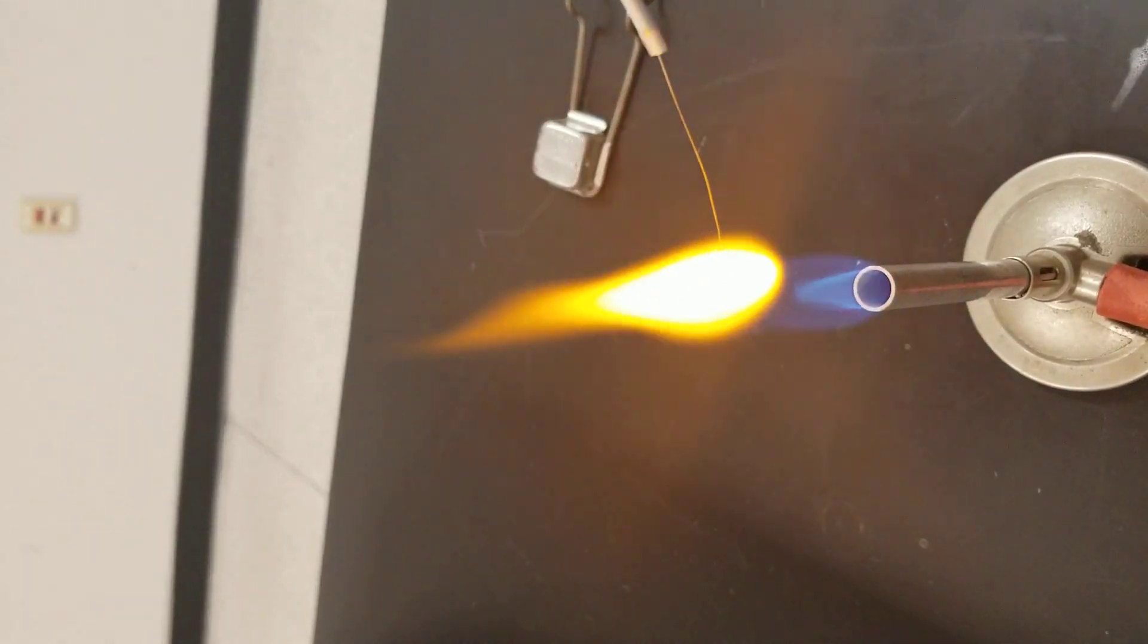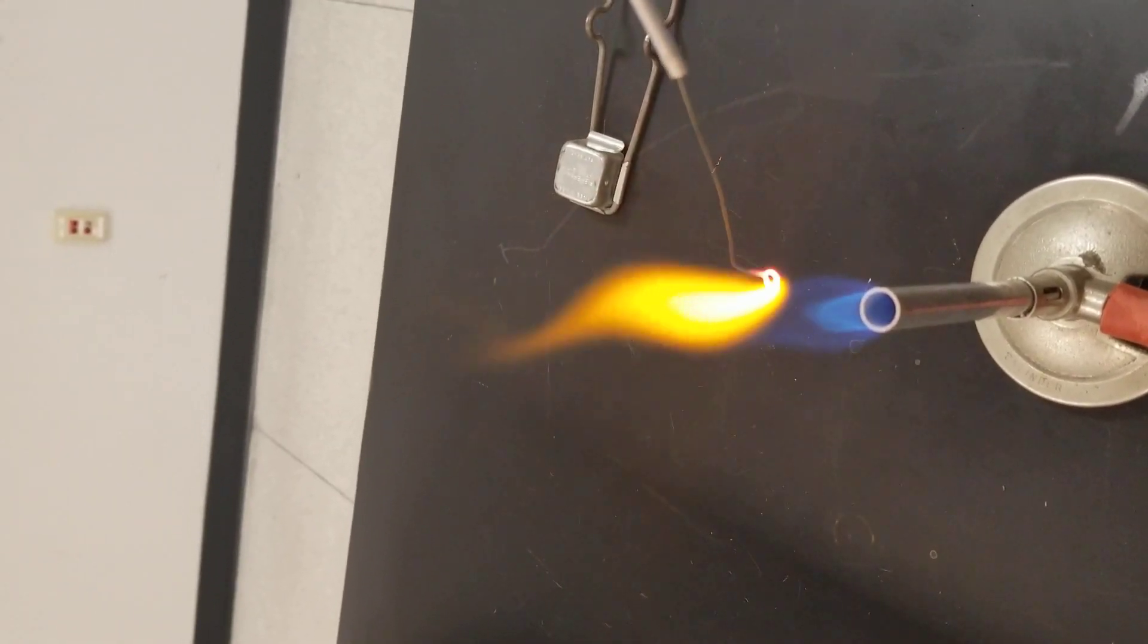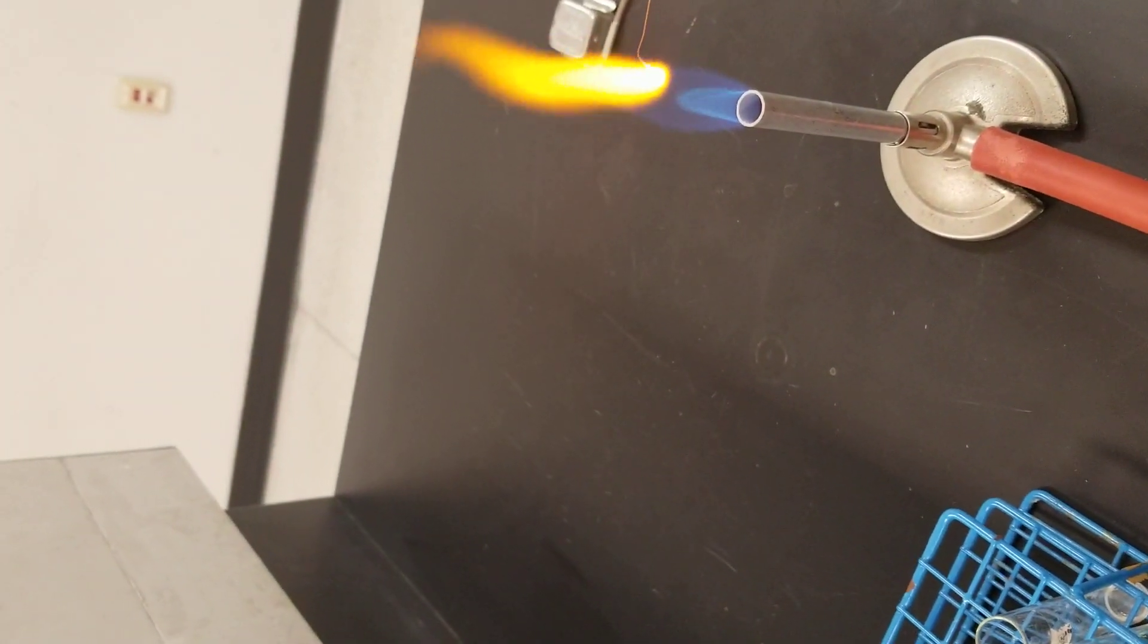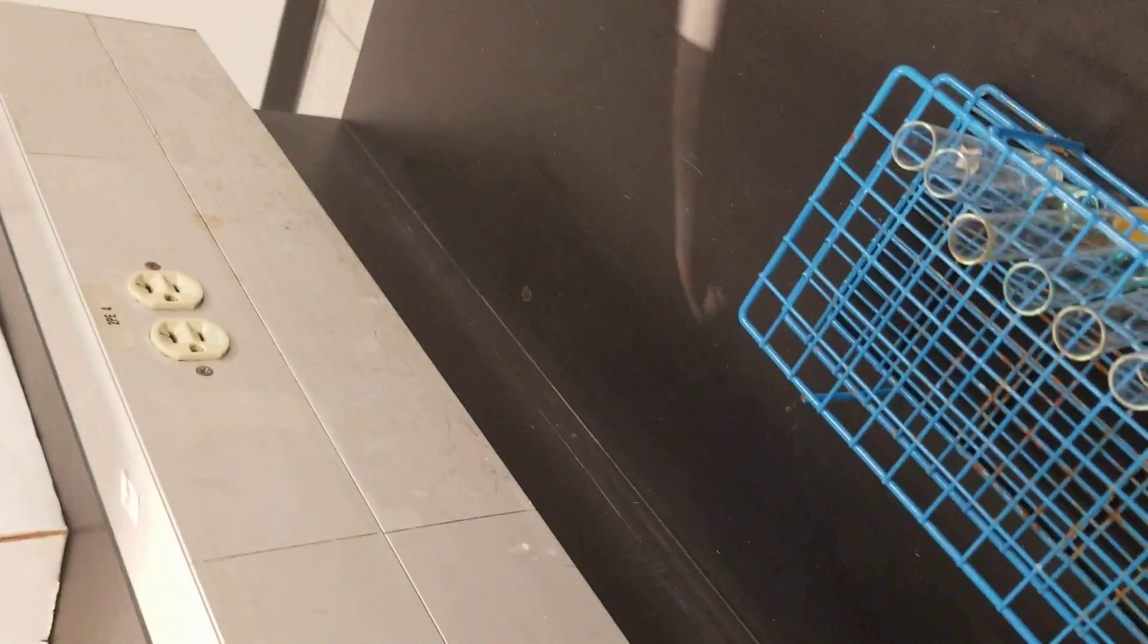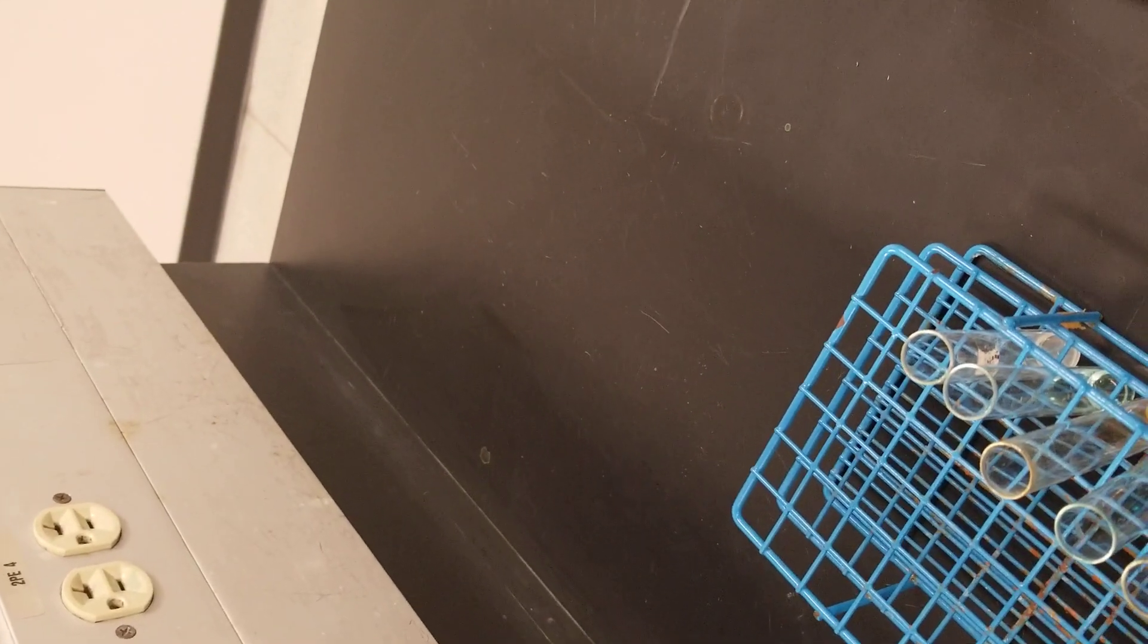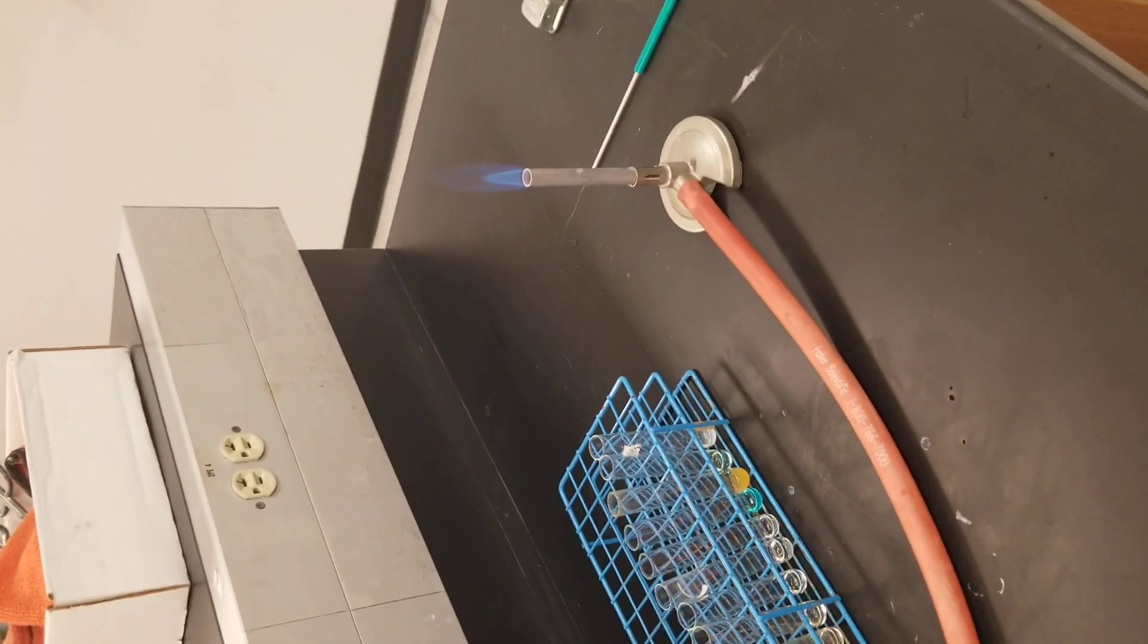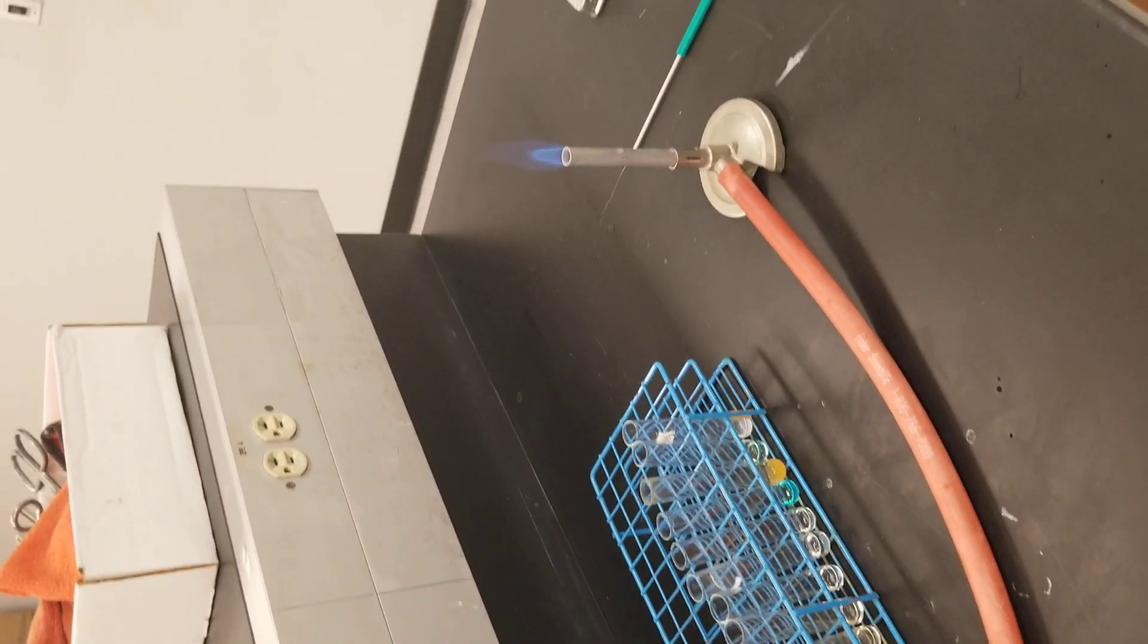Sodium gives you a yellowish-orange flame. This is how we record the flame color of the metal solutions.